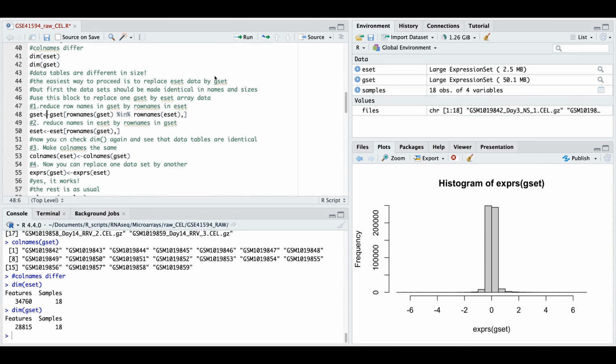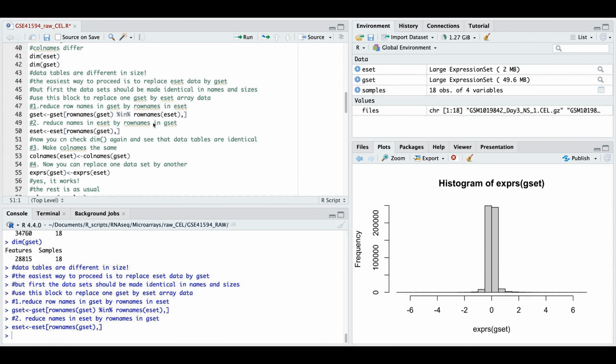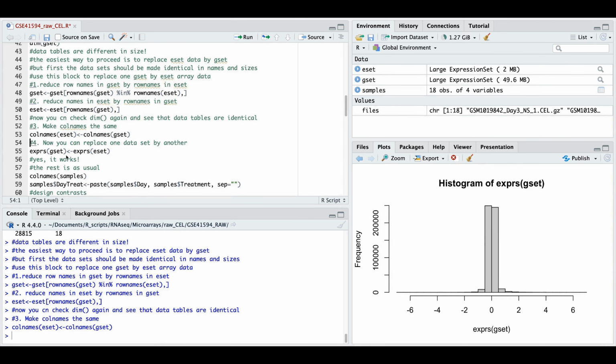First we say, let's get G set only those row names which are in E set. Then we say, let's get E set only those row names which are in G set. And therefore now the features in E set and G set are the same. And now we have to make equal headers for column names, so E set column names are the same as in G set. And now we are ready to replace one set by another, but we will skip this step for a moment. Why? Because we also want to compare the data.